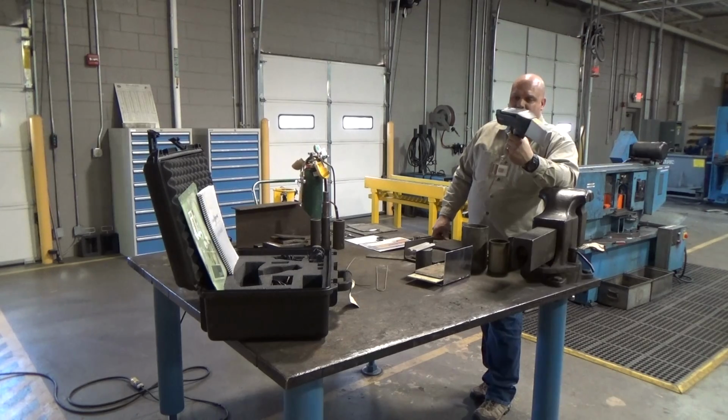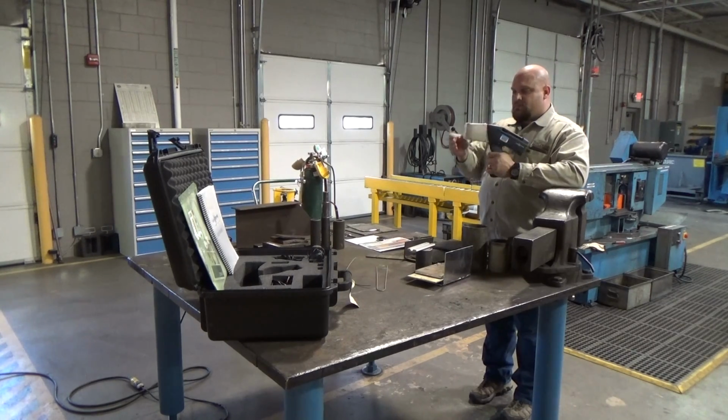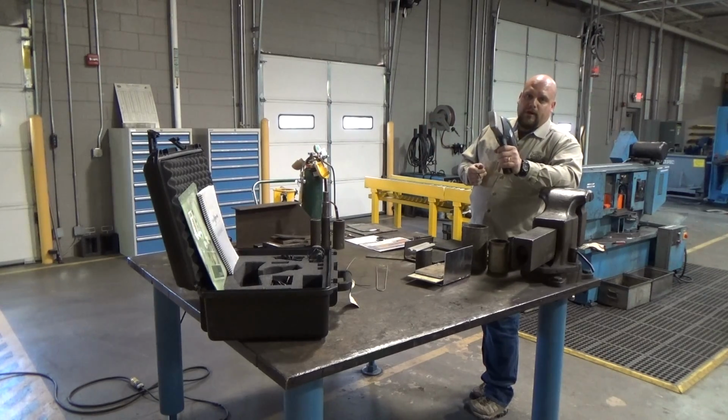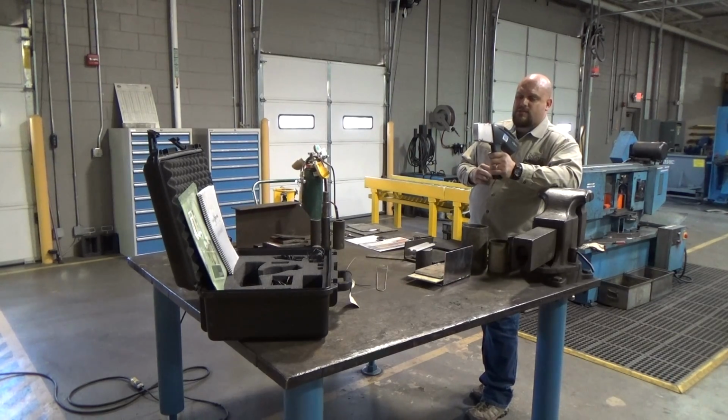This type of technology has been out for a number of years. So now there are a number of refinements that have been made. This particular model cannot tell you carbon content, and that can be very important when we start talking about our different types of steels. So the machine relies on the different chemistries, all the other alloys that make it up, not only just the carbon content, to identify it.